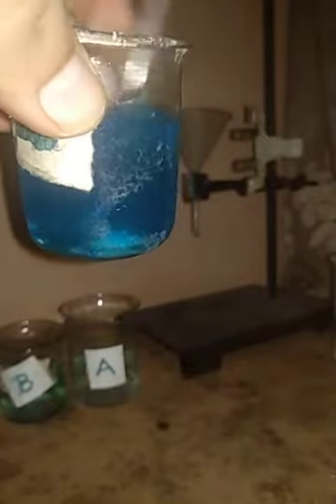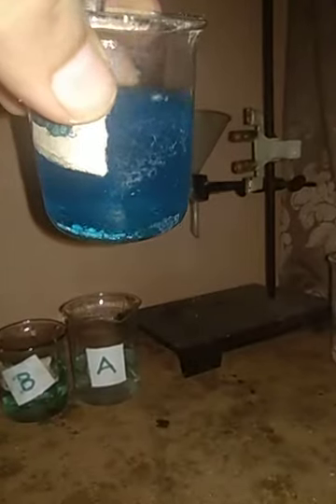So we have a huge amount of crystals of copper sulfate available with us. Let me even try with some more. Let me add a good amount of copper sulfate to the same, and let me check it out. See, I have a huge amount of crystals that are present in the solution, and we have been trying to dissolve them.